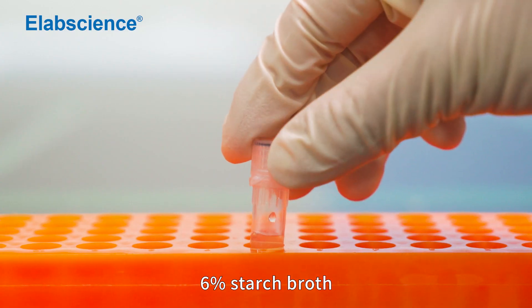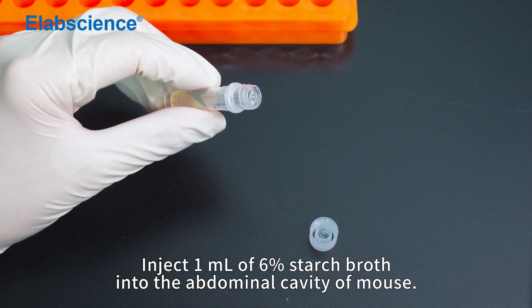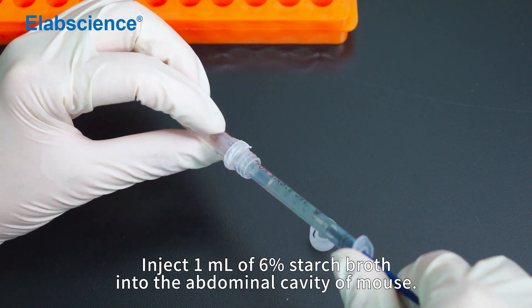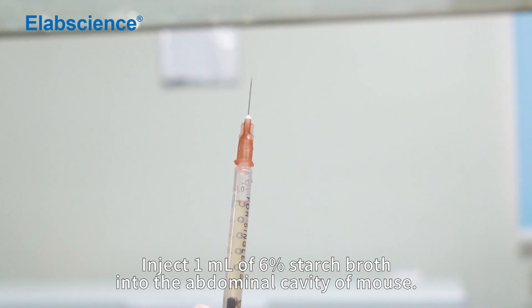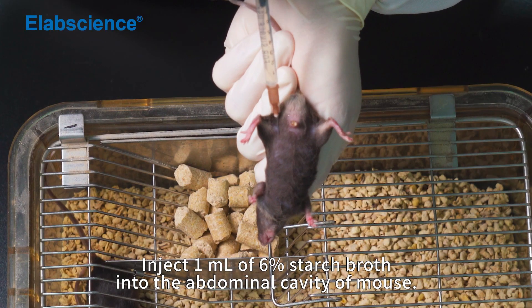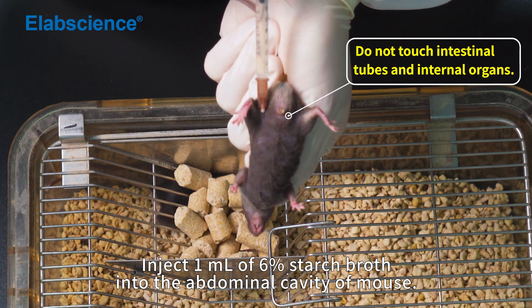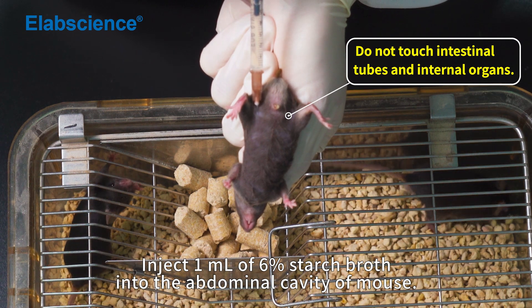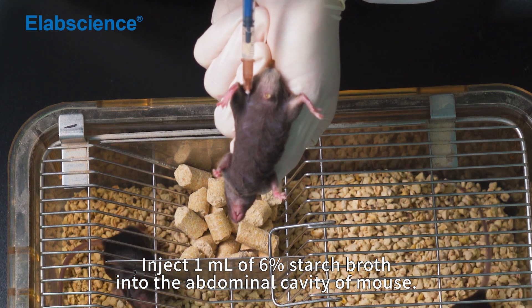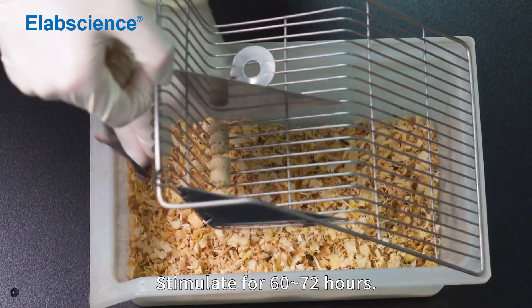Model Establishment: Inject 1 ml of 6% starch broth into the abdominal cavity of the mouse. Stimulate for 60 to 72 hours.